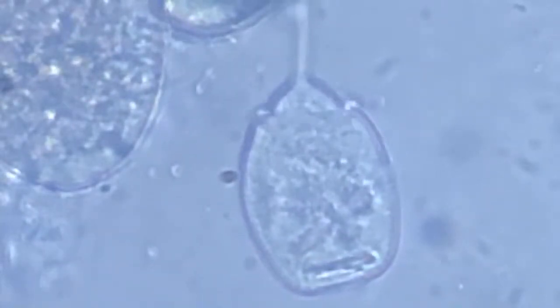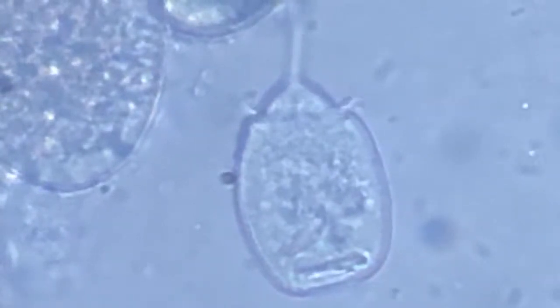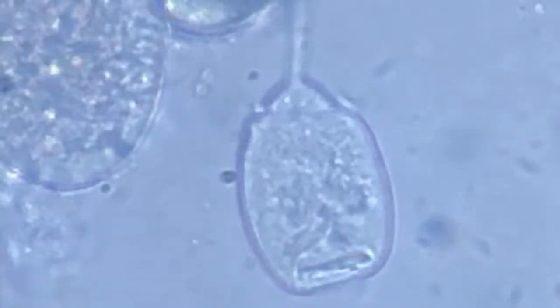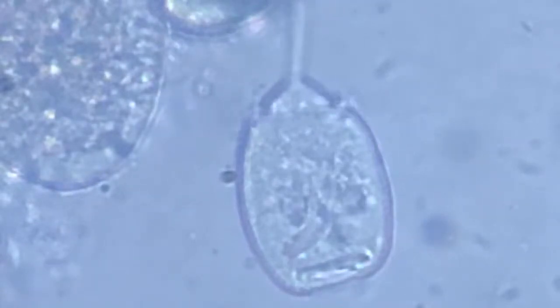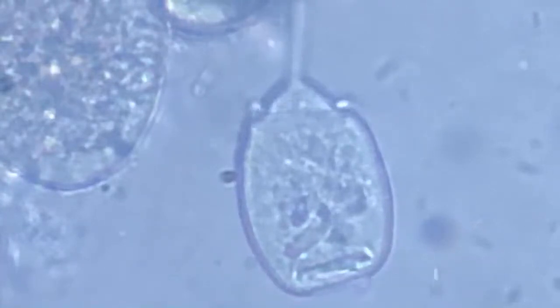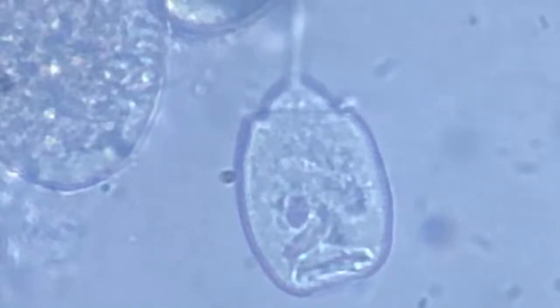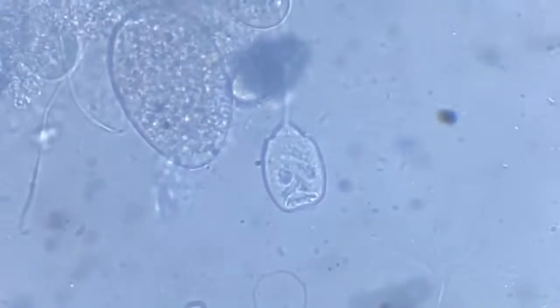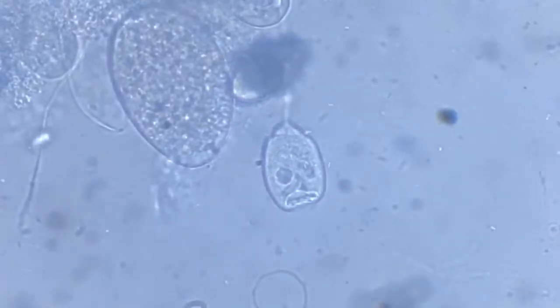Yes, that was it. So it vacuated itself, and now another vacuole will be formed. This is so interesting. Now you see another vacuole being generated. Slowly, a very prominent eye-like structure is being formed. It looks like a small baby face. That was so interesting, fascinating.